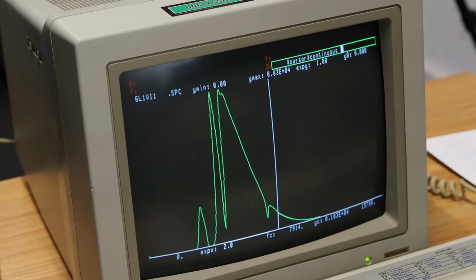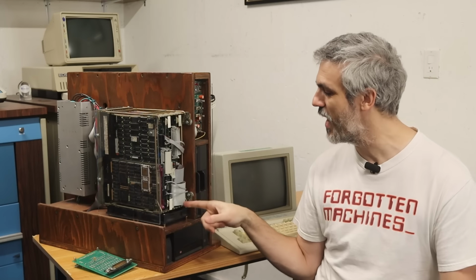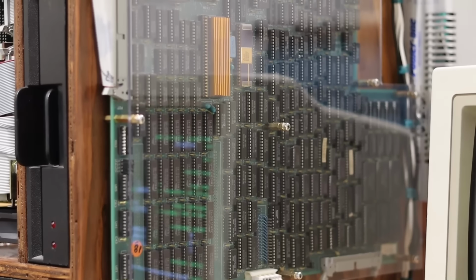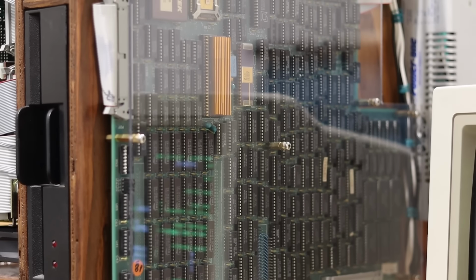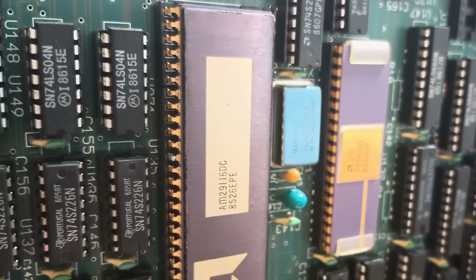So we can get this really cool screen that shows the spectra of whatever it is that we just checked with the spectrometer. Then we also have the DEB18 over here. This is a card specifically for talking to the high-performance vector processor. And this vector processor add-on turns the PDP-11 essentially into a very compact supercomputer.